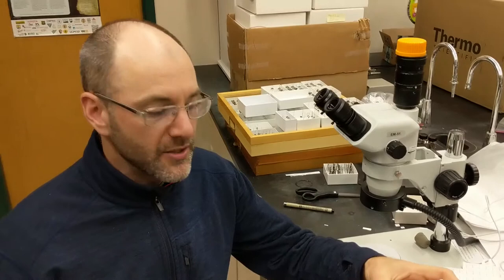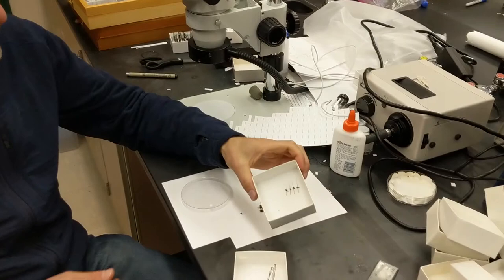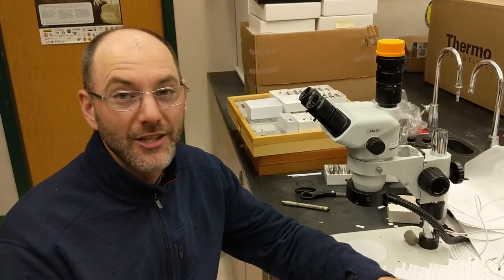Ideally the top of the specimen will be seven or eight millimeters from the top of the pin. If you're gluing them in the middle of the pin, that's way too low — we're not going to have any space for labels, especially if we're adhering two, three, or four labels to these things. Set a standard on the first one, and as you do more, aim for that set height. I just eyeball it, and mine ranged from seven to almost ten mil. Seven's better.